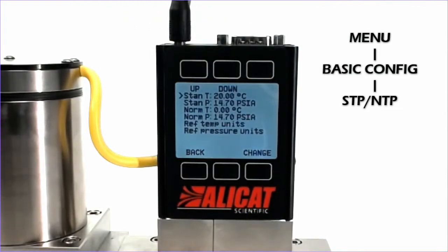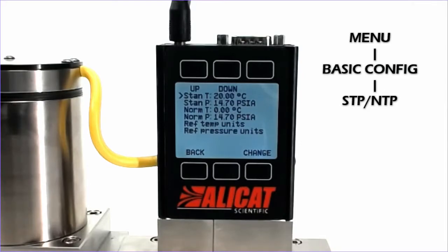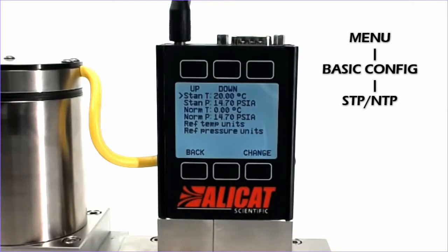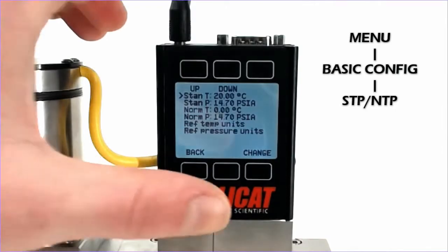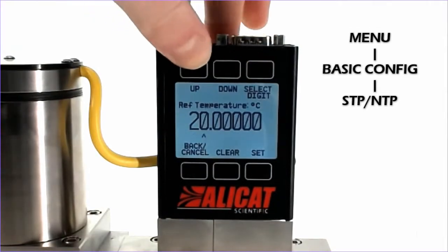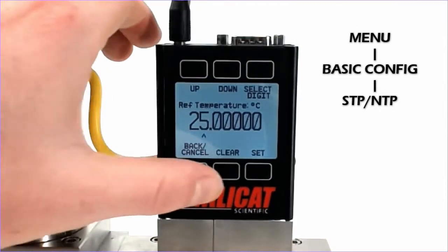Now we see there is a list of default values for STP and NTP. If we would like to change this — say we would like to change our STP to 25 degrees Celsius — we will hit Change, select Digit, and just move this up to 25. Hit Set.